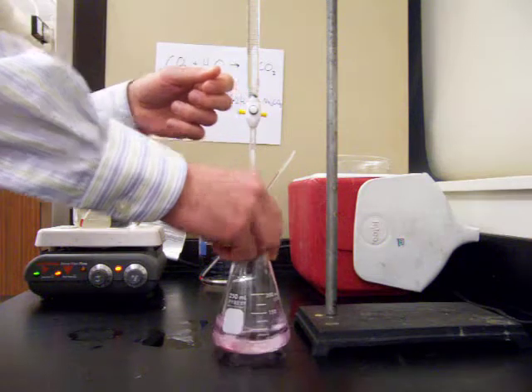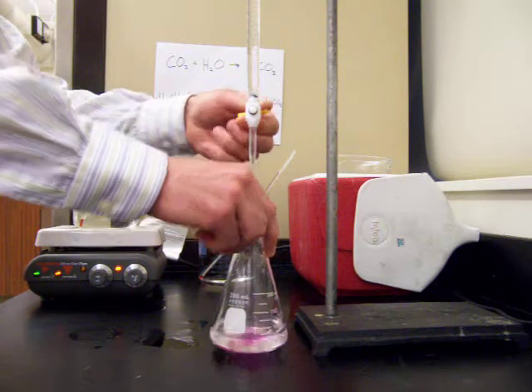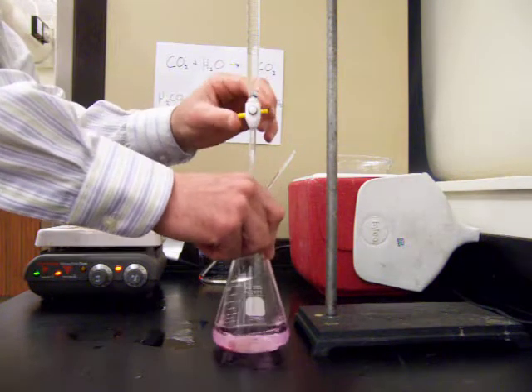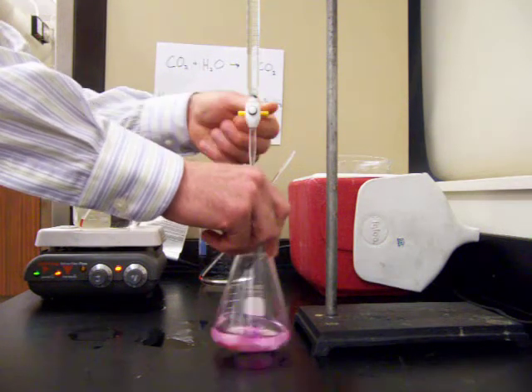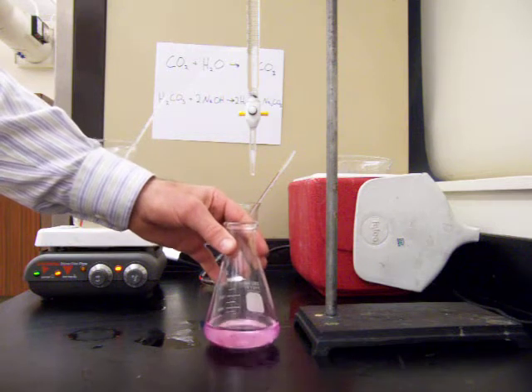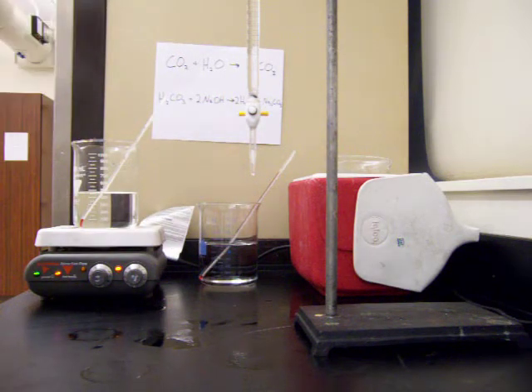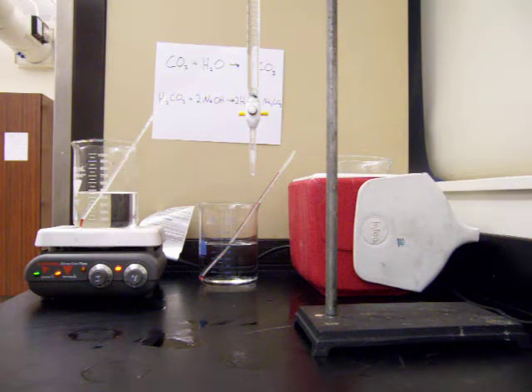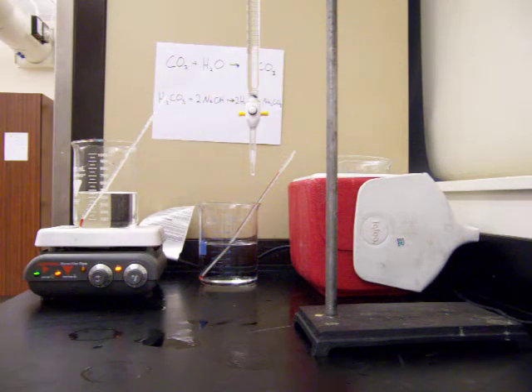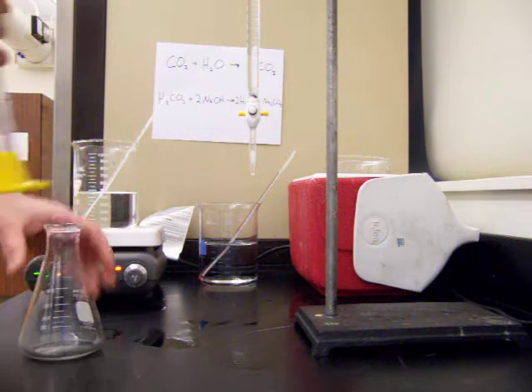I can already see that this is taking more sodium hydroxide to reach the equivalence point. We're getting closer — it's starting to stay pink a little bit longer — so we should titrate more slowly now. There it is: we've reached the equivalence point, with a nice pink solution showing the carbonic acid has been completely neutralized. The final reading on the burette is 28.3 milliliters. The difference between 12.1 and 28.3 gives the total volume of sodium hydroxide needed; remember the molarity is 0.2 molar.